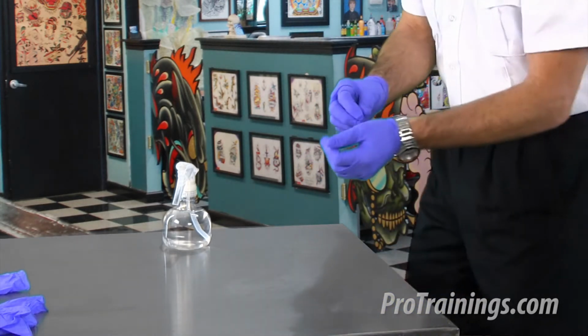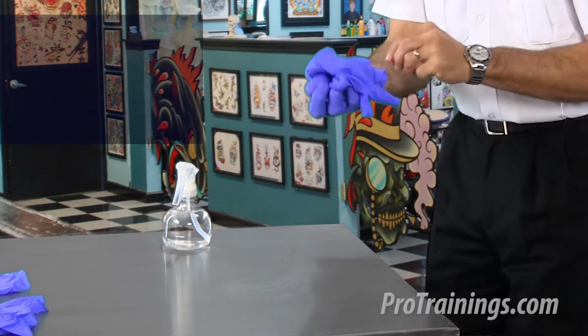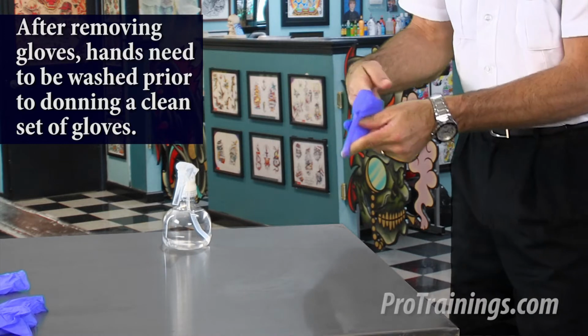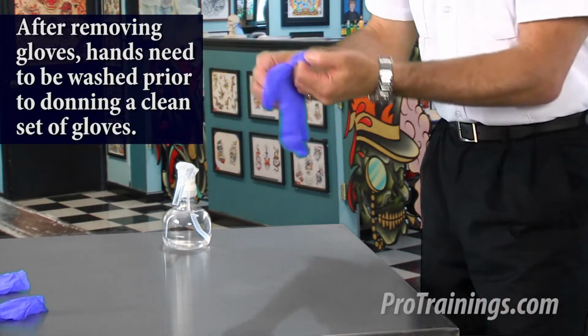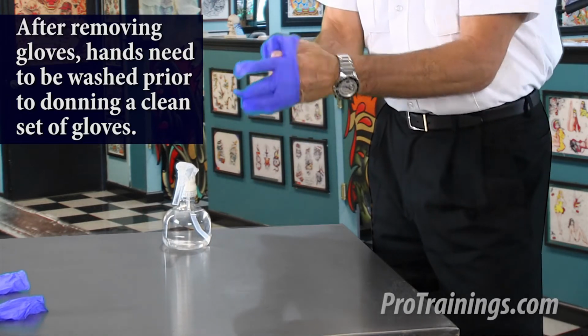Then we're going to properly remove the gloves. Then the finger on the inside, into the trash it goes. Now we don our second pair of clean gloves.